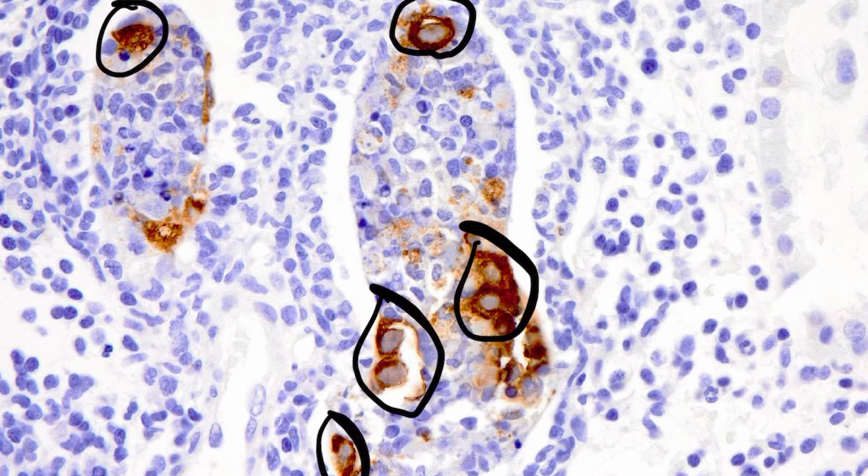Of final note, a few other helpful histologic findings that may be seen in an adenovirus infection, although not seen here, include interstitial hemorrhage as well as granuloma formation around infected tubules.